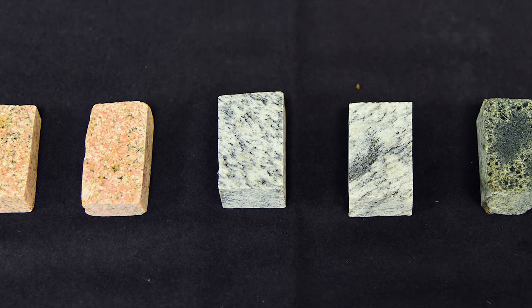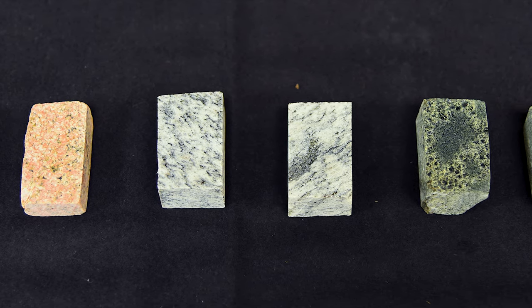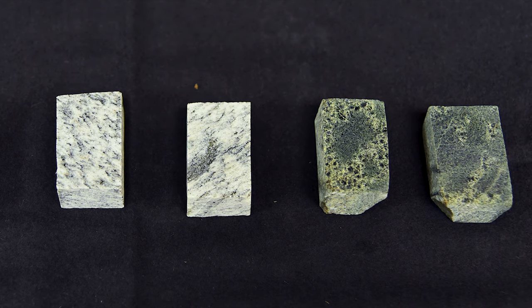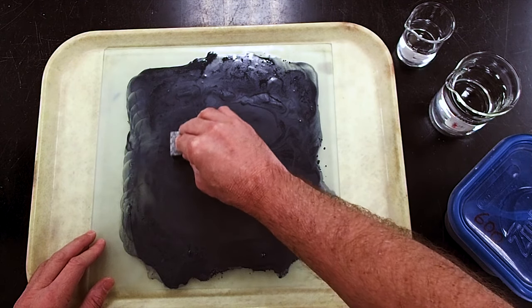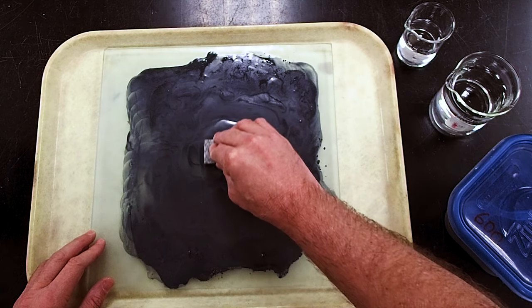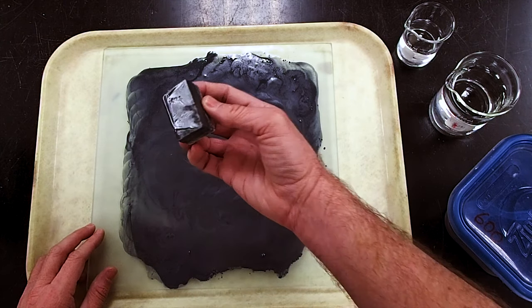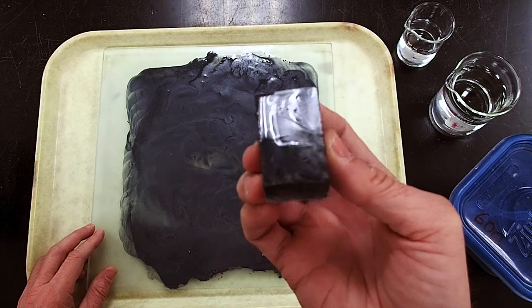Now that the sample chips have been polished, it is important to ensure that the surface is free of any grit or debris before epoxying it to a glass slide. This is especially important if you are polishing your chips using loose grit on a glass plate or wheel, as the fine grit or rock particulates removed from the sample may cling to the surface or remain embedded within small fractures in the chip.